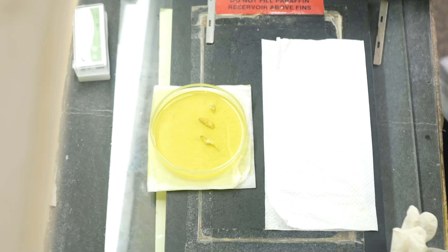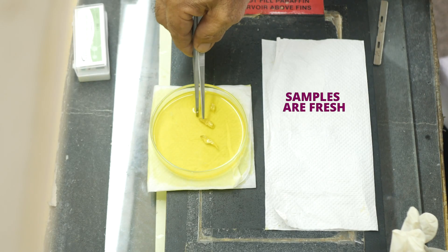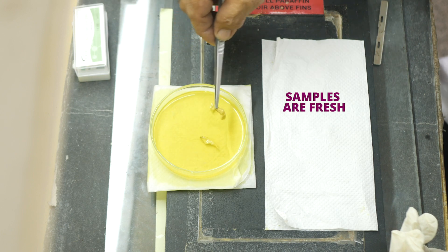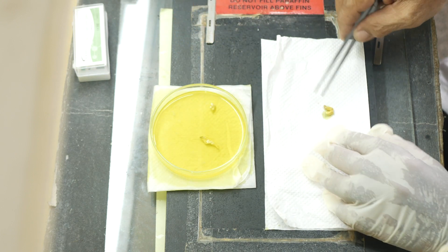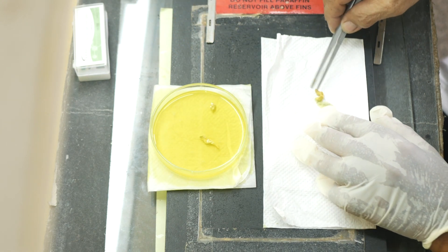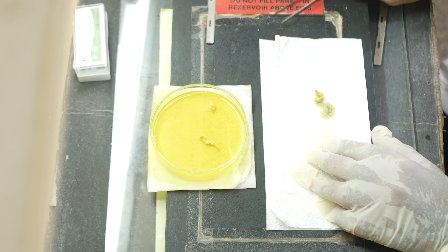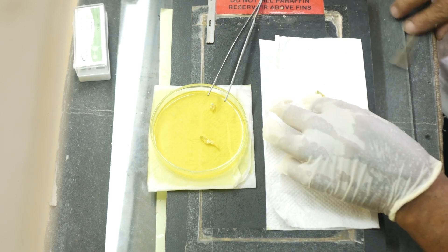Join me as I walk you through the histology procedures and techniques. First, we must ensure that our samples are fresh. This way, we can produce high-quality results from well-prepared slides. The next step is fixation.